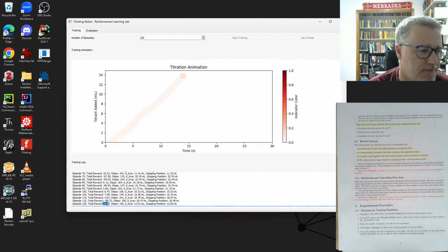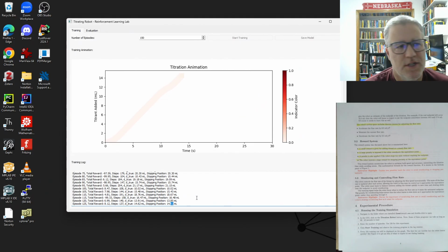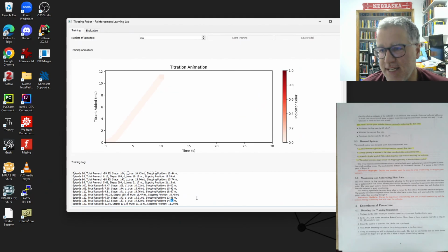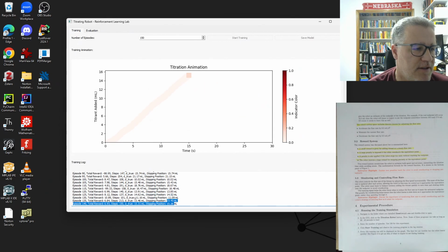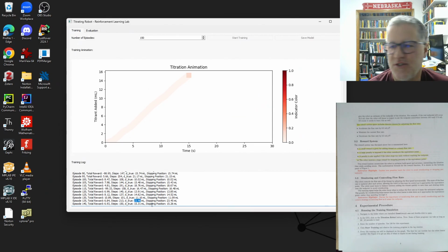And here we can see stopping a little bit early. So we stopped 14.52, and here's 14.62. So hopefully we'll, although we're getting to the end of our run, we'll see if we can get even a little bit better than that. There's a nice hit there. So 23.45 and 23.46 is what it was supposed to be. And you saw that about the right color of the indicator there.